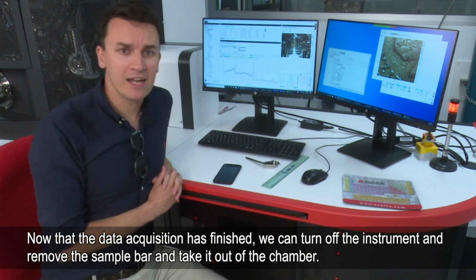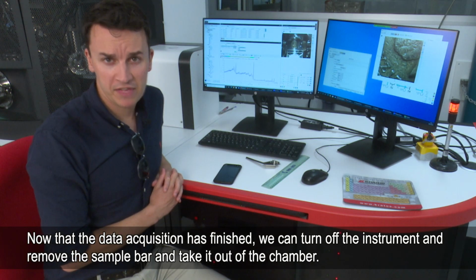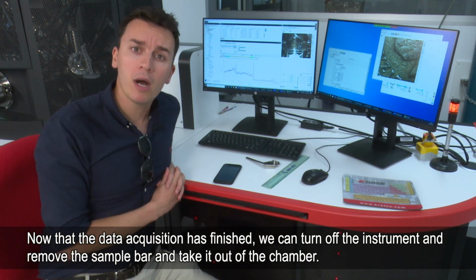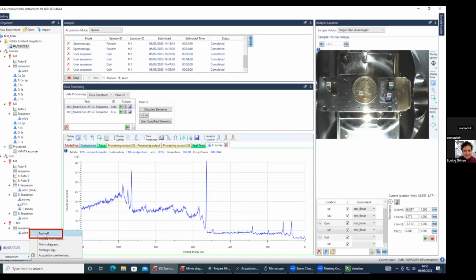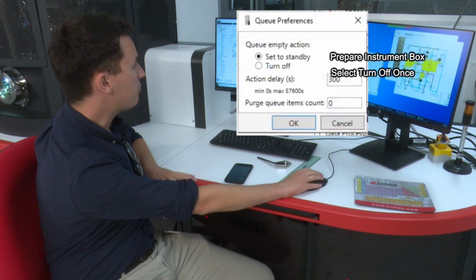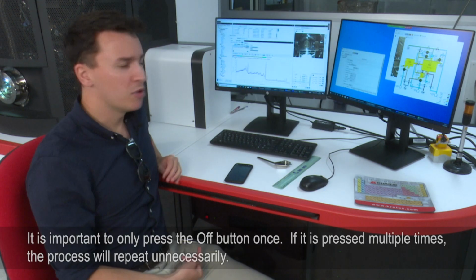So now that the data acquisition is finished, we can now turn off the instrument and remove the sample bar and take it out of the chamber. So first of all, we go to Instrument, right click, press Turn Off. And also in the Prepare Instrument box, I've just pressed Off. It's important that you only press it once.